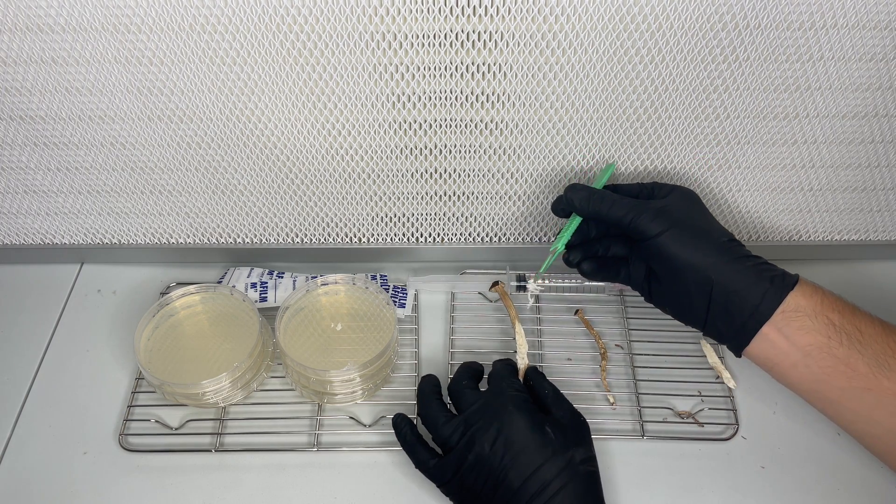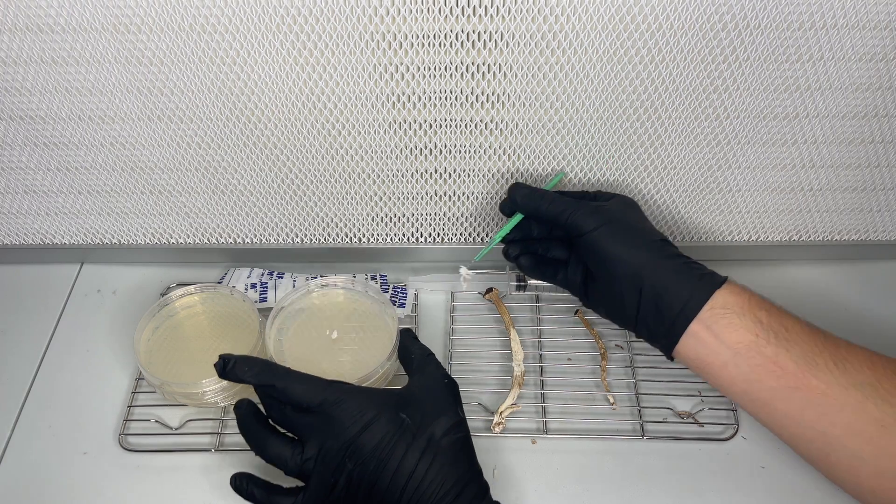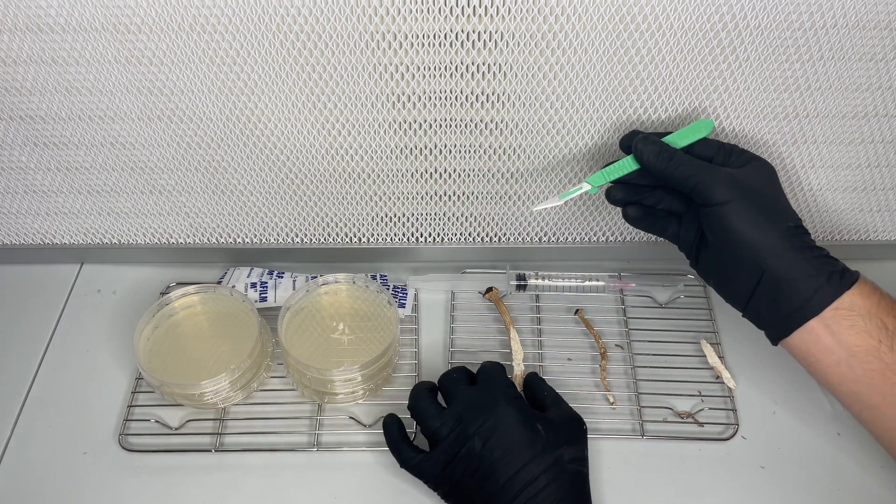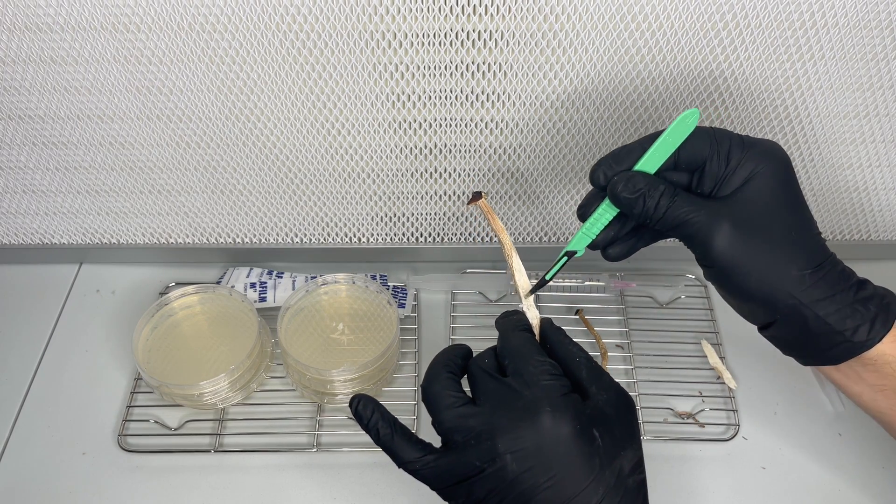The dried mushroom tissue is very flaky and that makes it hard to get it to stick on the scalpel, especially with the flow hood blowing air at it.